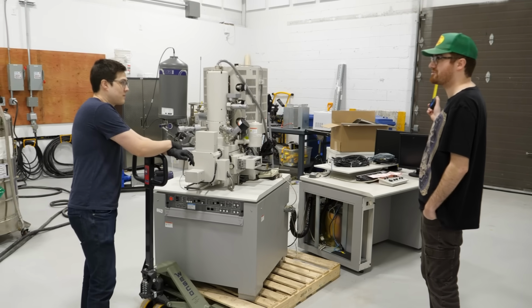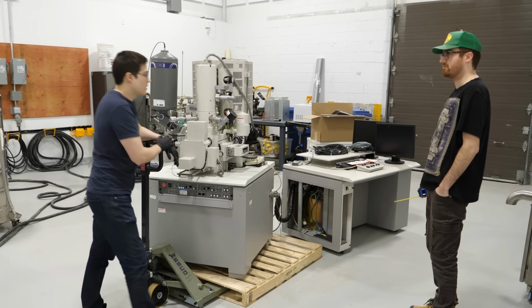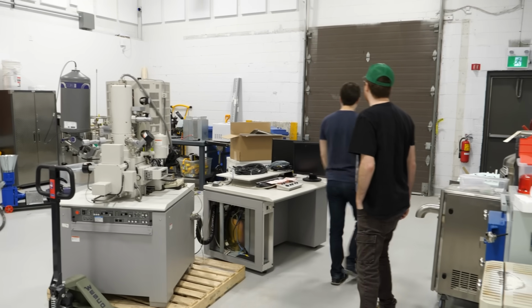Going to use that metal thing as the ramp. Yes. The only problem is it's 7 inches tall. This ramp's higher than our platform. That's fine. No. But how are we going to... No, it's not fine.